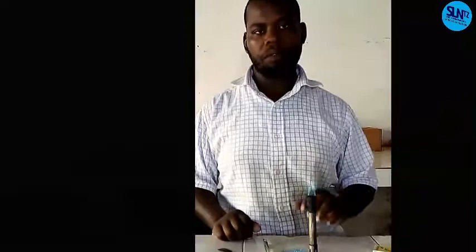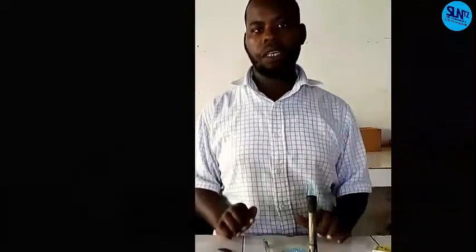I think that is the end of our flame testing of our solid sample, copper 2 sulphate. In another lesson, we learn the action of concentrated sulphuric acid on copper 2 sulphate, what observation, and how to write a report. I will come back within another lesson, and you will understand.